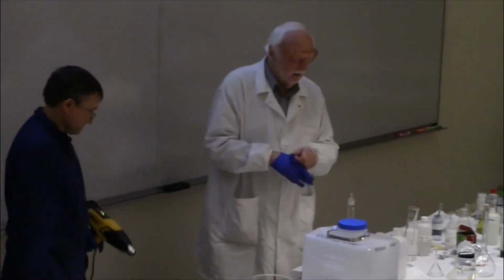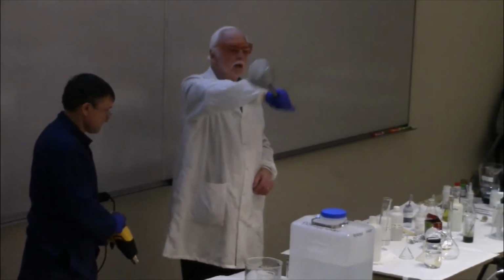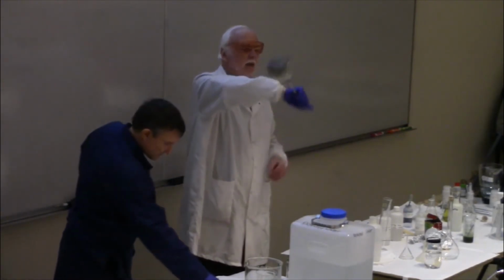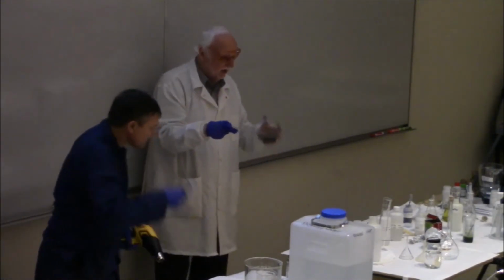Now, this is not a clean reaction. You see, it's starting to give silver metal. So what it does, it forms silver metal in the solution, a dispersion of fine particles. But if the bottle is clean, I hope I cleaned it well enough, eventually some of the silver will actually form a mirror on the surface of the glass.